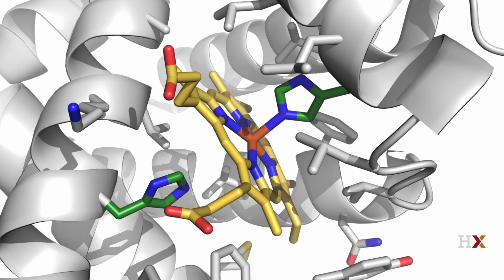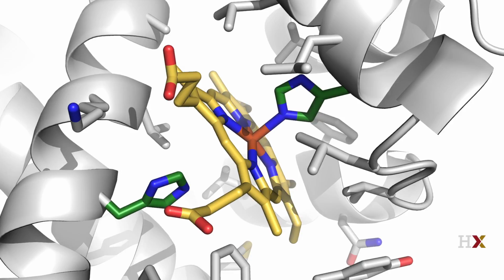A third tip is to explore the slab, or depth of field, which you can do using the scroll wheel on a 3-button mouse. Here I have made it shallow, which improves the depth perception around the heme. A fourth and final tip is also illustrated here. I maintain the convention of showing oxygen in red and nitrogen in blue. That also means that I generally avoid using bright red and blue for other purposes in my illustrations. Here I have used gray, green, and yellow.